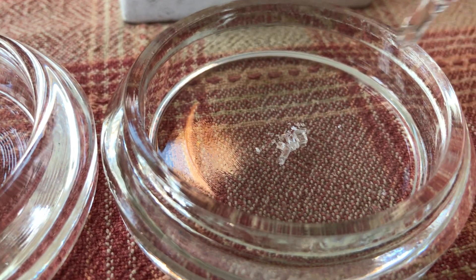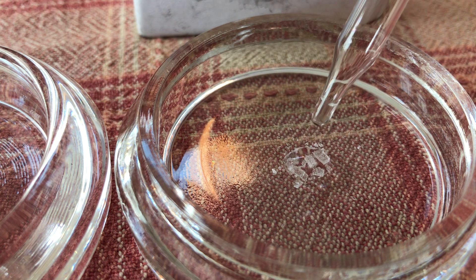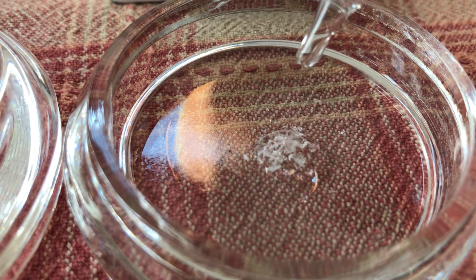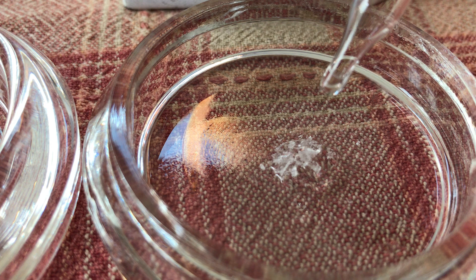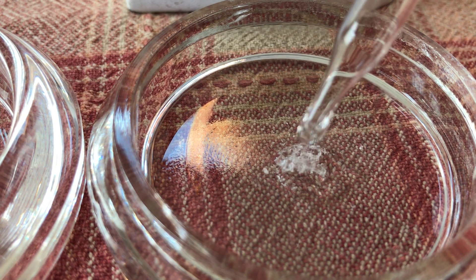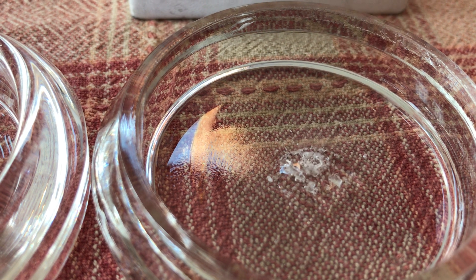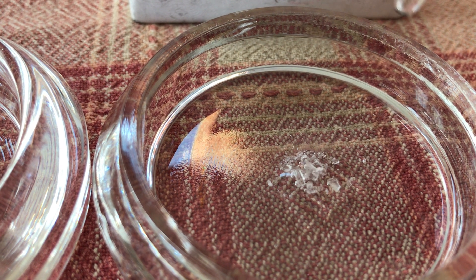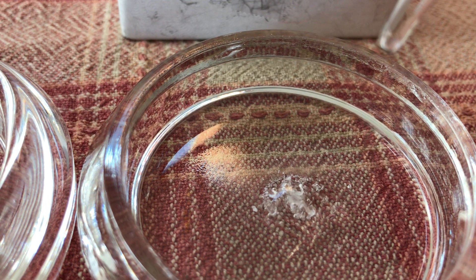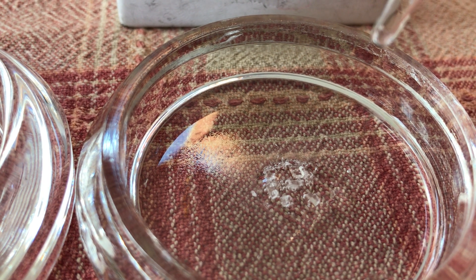On the other hand, with our calcite, what we should see is a fizzing or bubbling reaction. And if you look closely, you can see the bubbles and the fizz from the calcite reacting with the hydrochloric acid — very similar to the reaction baking soda has with hydrochloric acid, just not as vigorous.